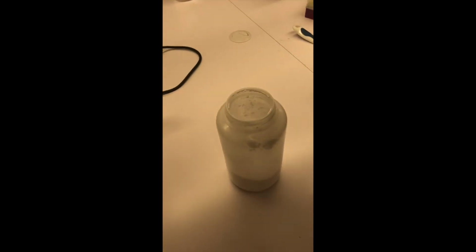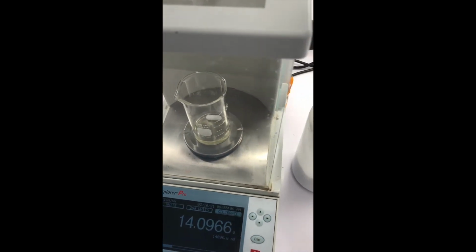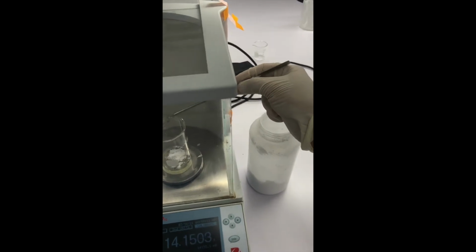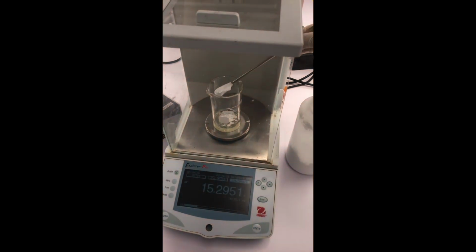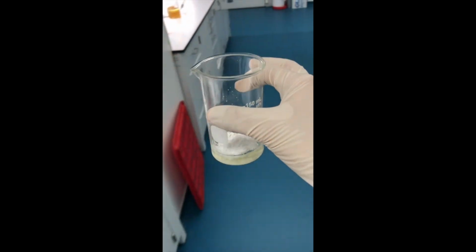And so once I have enough oil to make a sample that contains 70% oil, I can begin to add my sugar. And so this is just the confectionery sugar, which I sealed tightly in a container. Now I opened it, and basically I'm just going to try and grab some sugar. Oh, make sure nothing falls. And then just slowly add it so that my sample will actually get up to 20 grams. Because if I'm making a 70 oil, 30 sugar sample, then that roughly equates to it. So there we go. We have our 20 grams of sugar and oil.